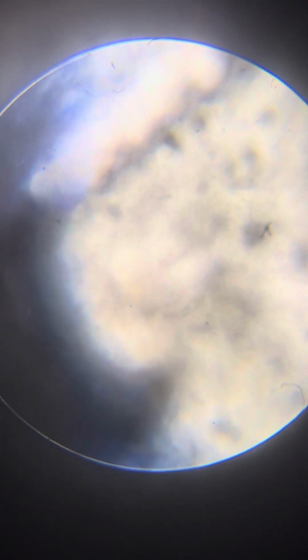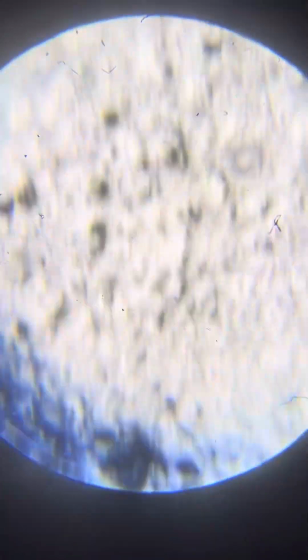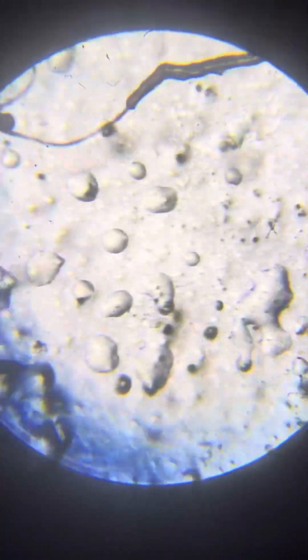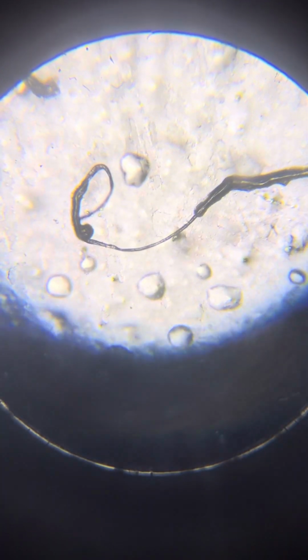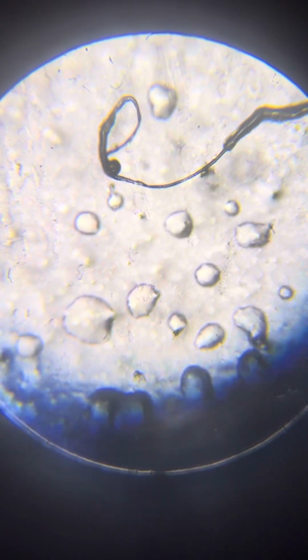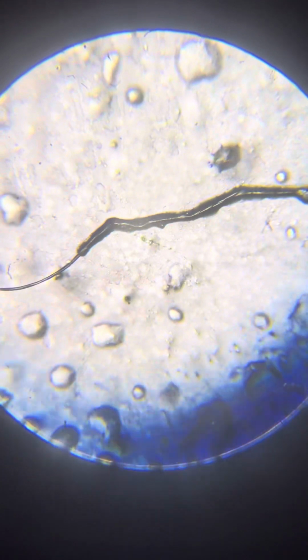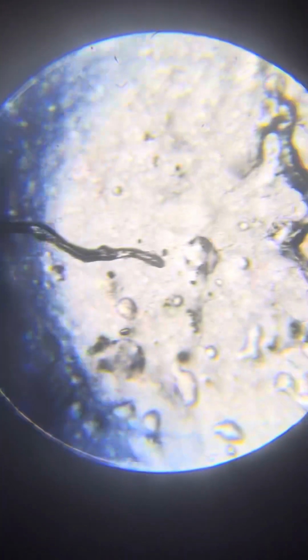Let's get back to 64. More life forms. Wow, this one is big. Wow, what a nice sausage we have here. This one is huge. I mean, this is 64 magnification. I should remind you, a pretty small magnification, and this one is freaking huge. Very nice.